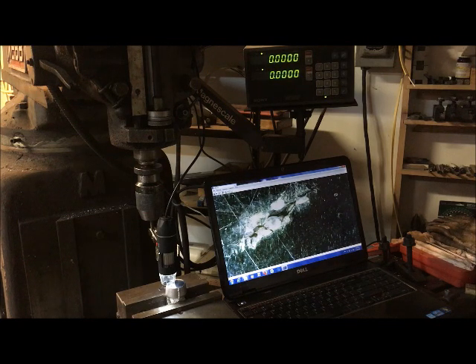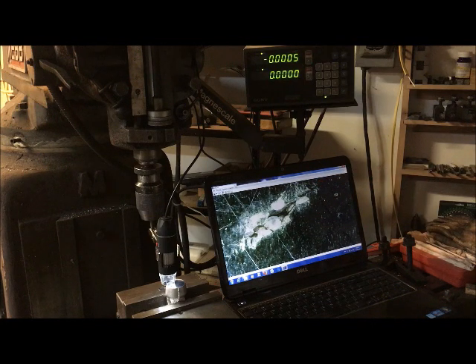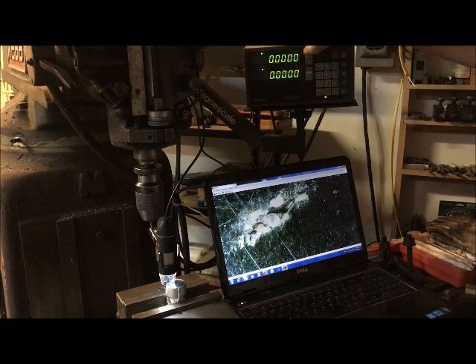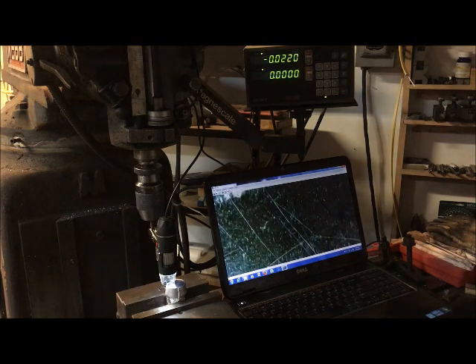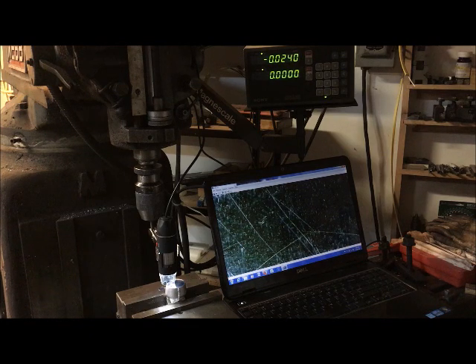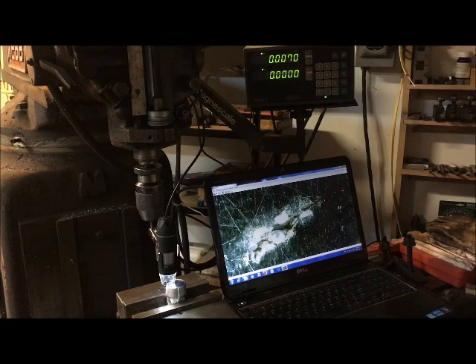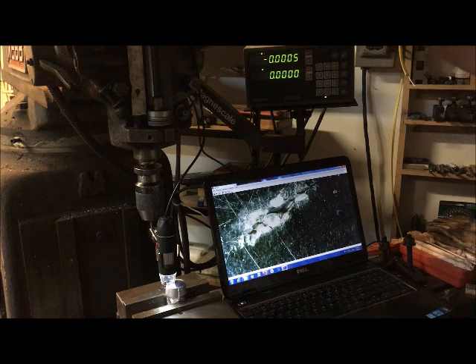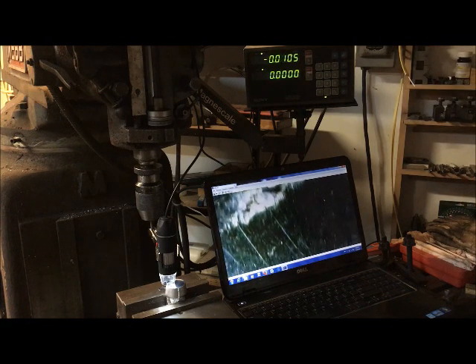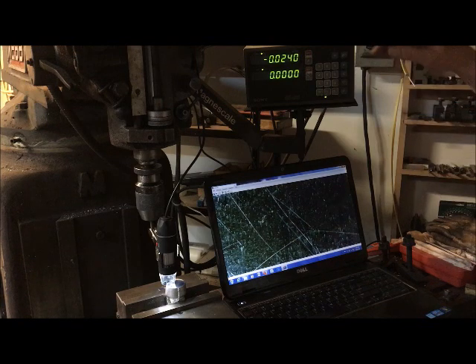So now the main thing I wanted to demonstrate is the ease of getting dimensions. So if I look at the top of this defect, and I move it right to the edge, now we're at zero. From the top of the defect to the bottom of the defect is 24 thousandths. And we can do it again. There's the top of the defect. I'm half a thousandth off, but I'll re-zero it. And you come back to the bottom of the defect, and it's still 24 thousandths.